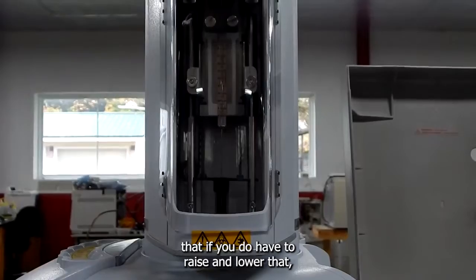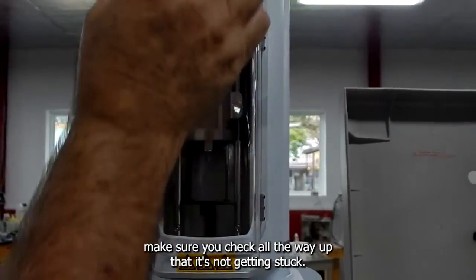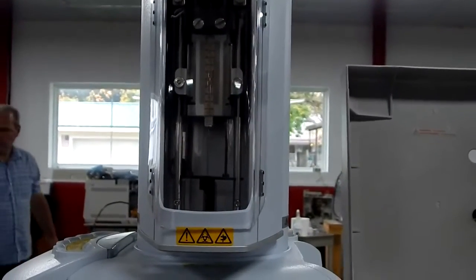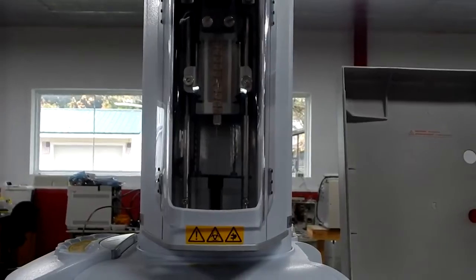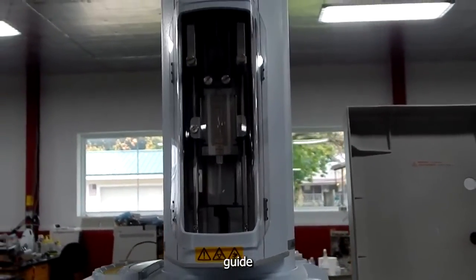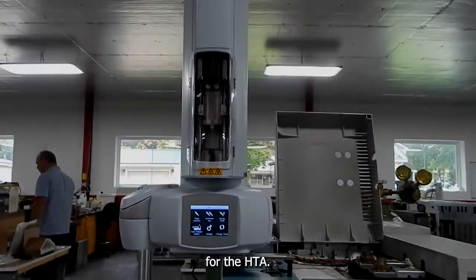And make sure that if you do have to raise and lower that, you check all the way up that it's not getting stuck. And so that is our little quick guide for the HTA. Great.